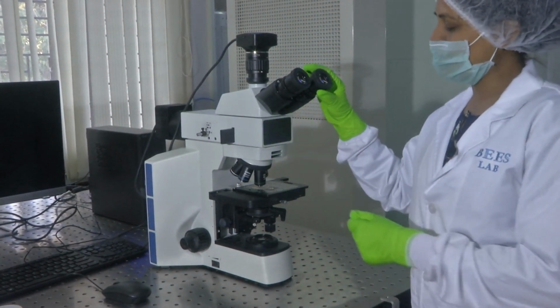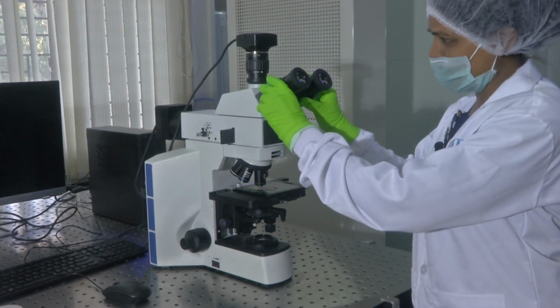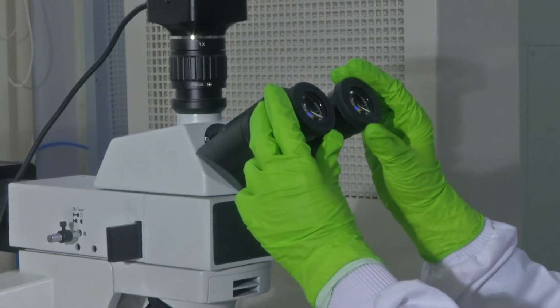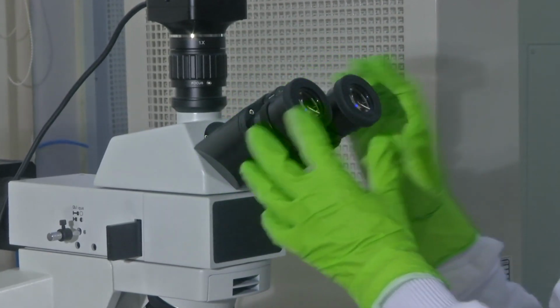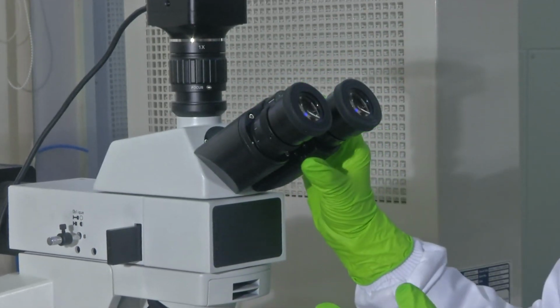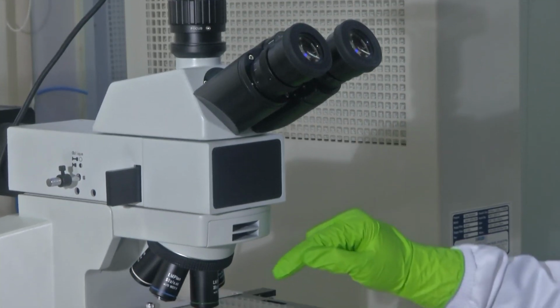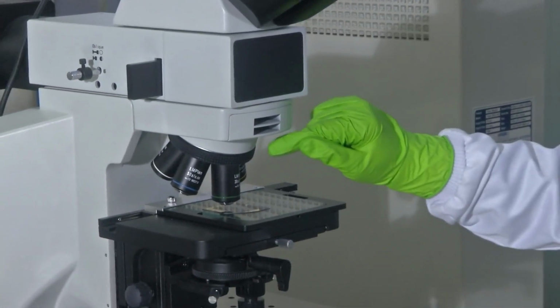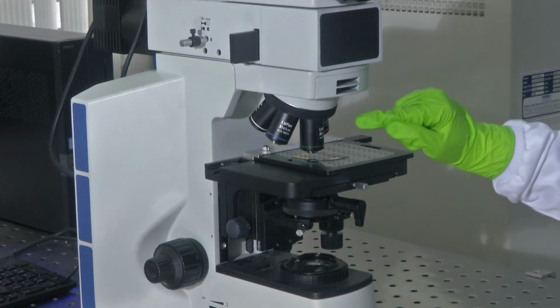Like the stereo microscope, they are also provided with the eyepiece here. The eyepiece lens can be adjusted this way, more like a comfort feature, which could help you fix it properly to your eyes and then see through the samples. This has both transmission and reflectance. Here what I mean is the light source: there are two light sources, one at the bottom and one at the top. Based on your application, you could use either or both of these light sources.